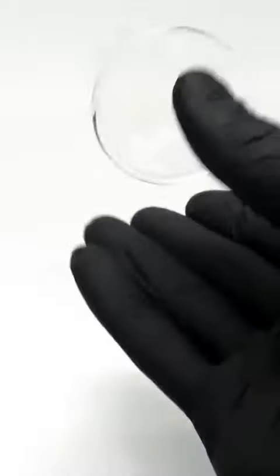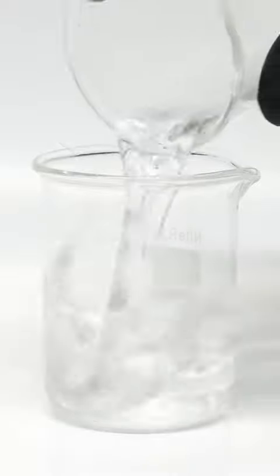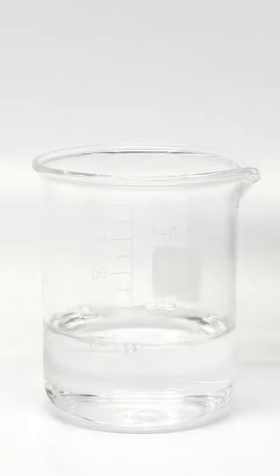Today, I've decided to try something that I saw on the internet. The first step is to pour some dilute hydrochloric acid into a beaker.